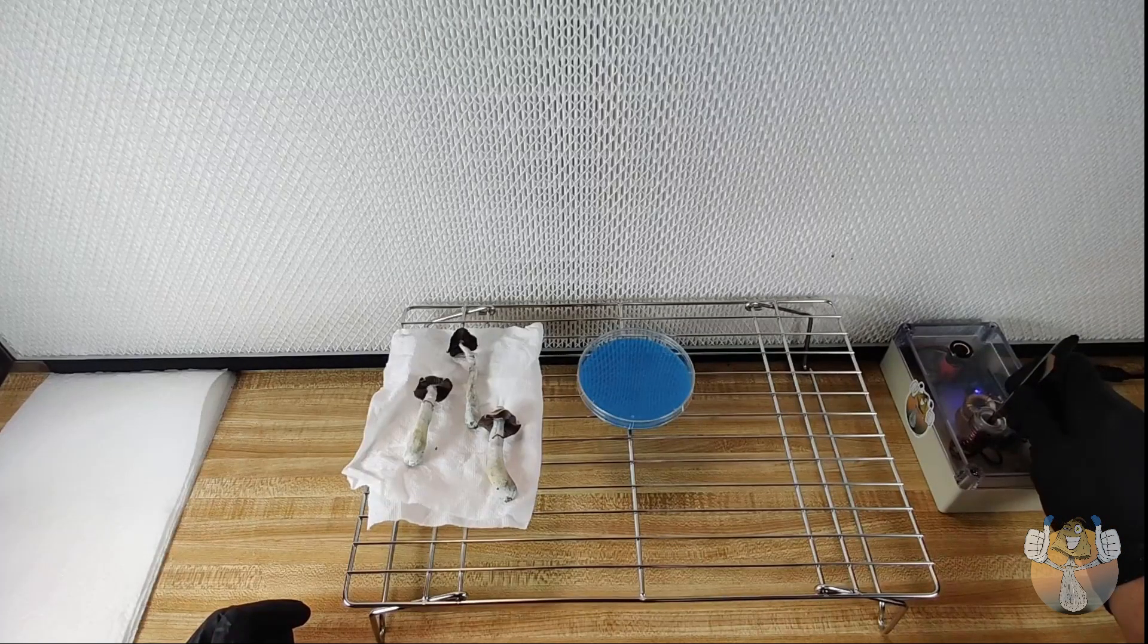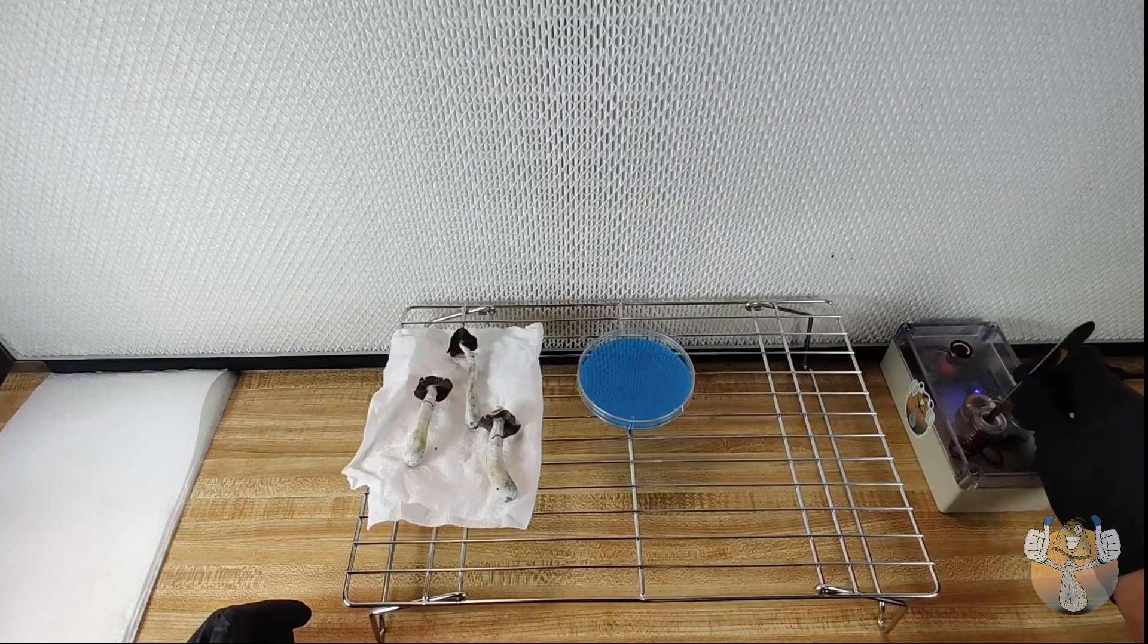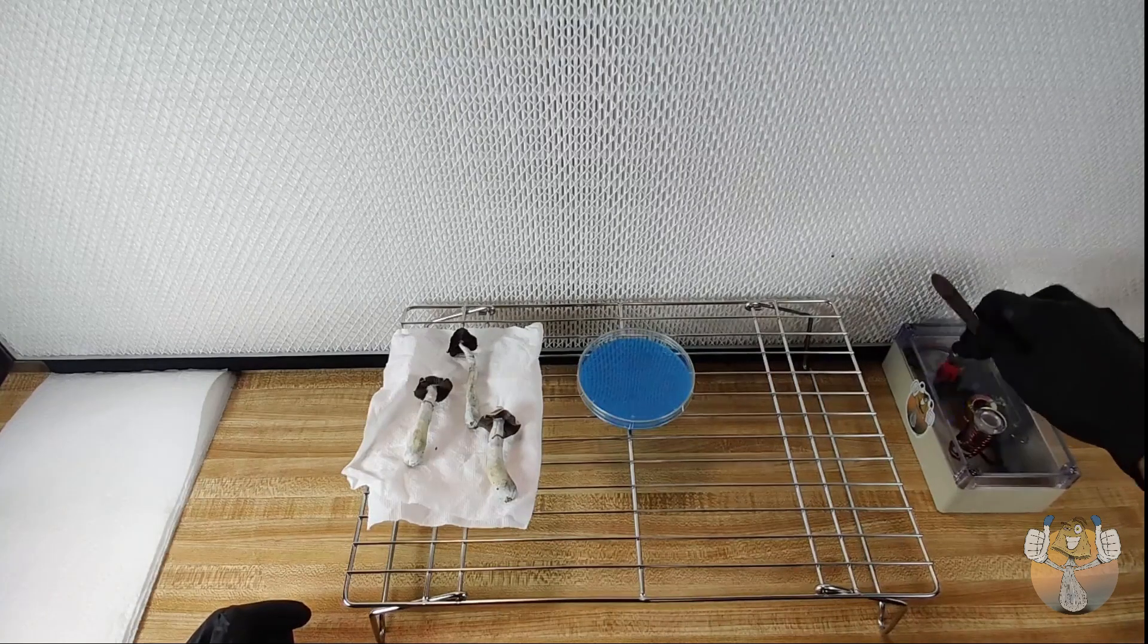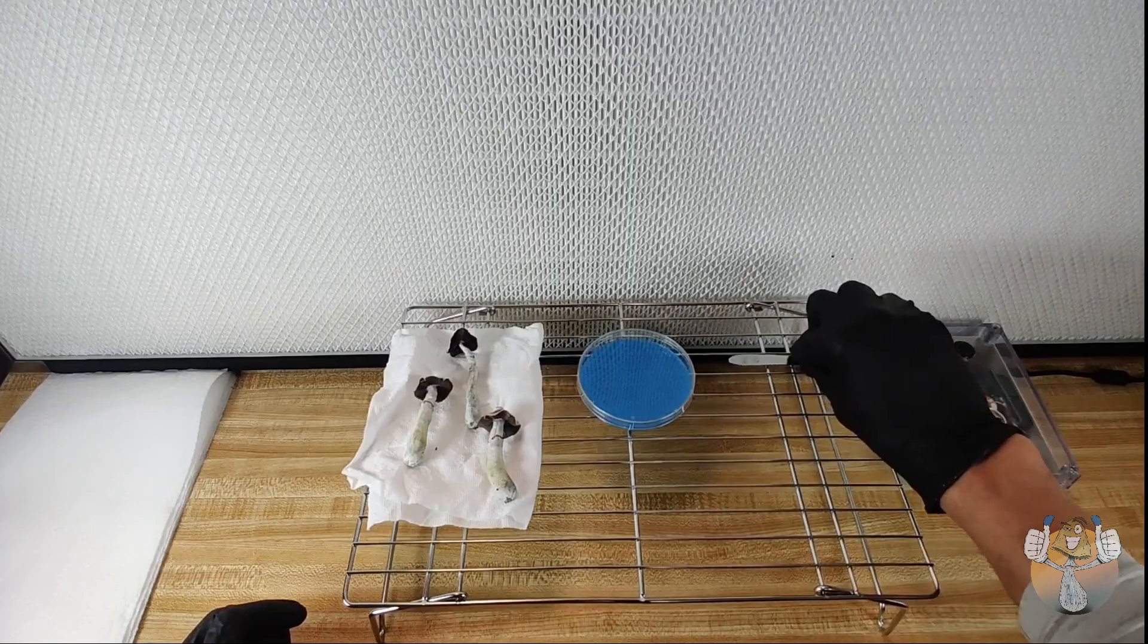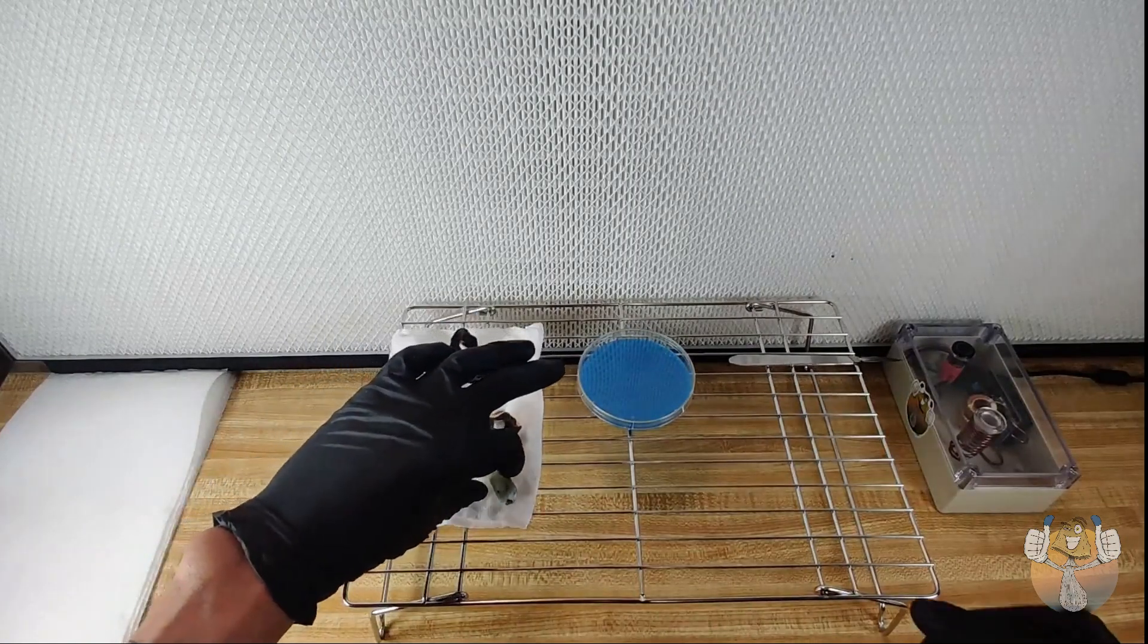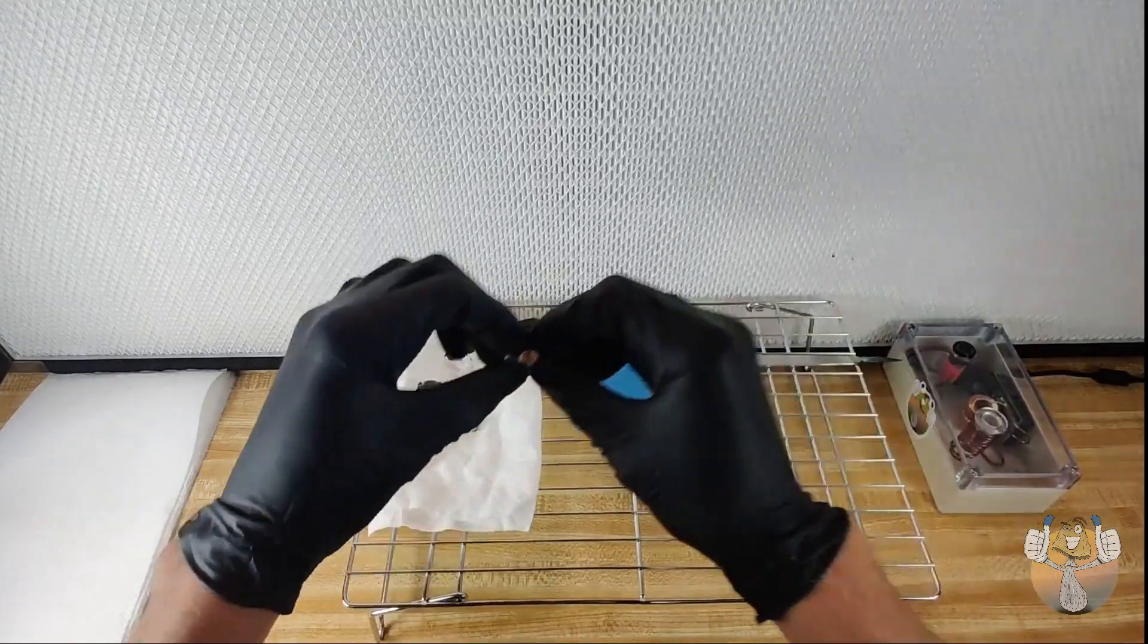Here we are. I have selected two fruits that I will be using for my cloning. These fruits came from an original clone transfer that I took in the beginning stages of my mycology journey, so I'm very proud of how these babies came out.